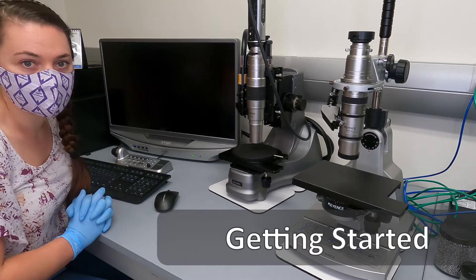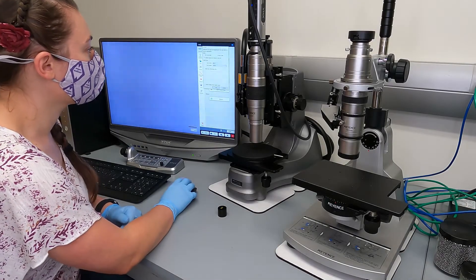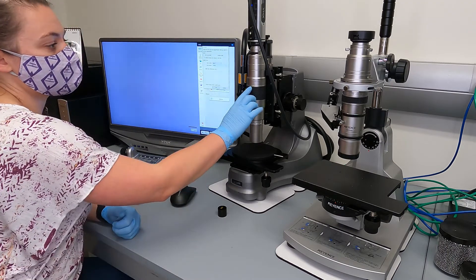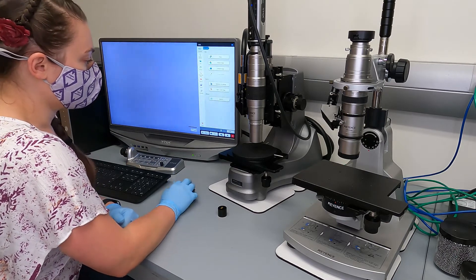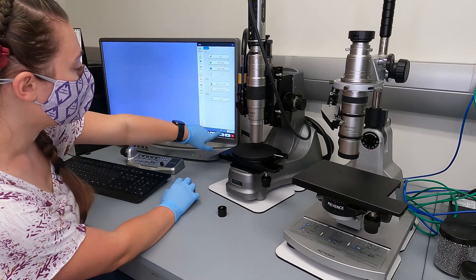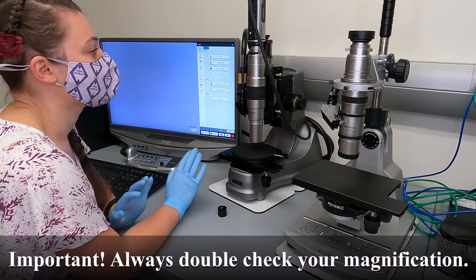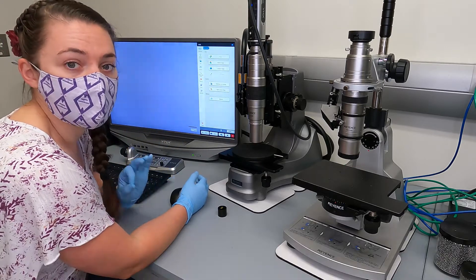The computer should already be on, so just the monitor needs to turn on. When the software starts up, there will be a pop-up with lens settings and you want to choose the lens power you're going to be working at. You can change this, so it doesn't really matter what you put here right now. I'm on 1000x right now, so I will choose 1000x and hit OK. Now 1000x has gone down into the bottom right corner where it says lens, so our scale bar will match.